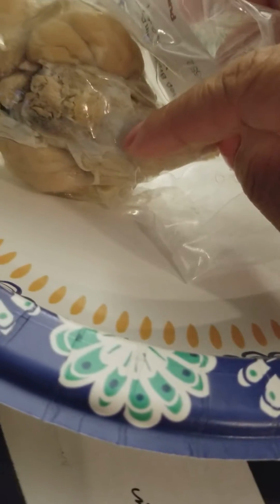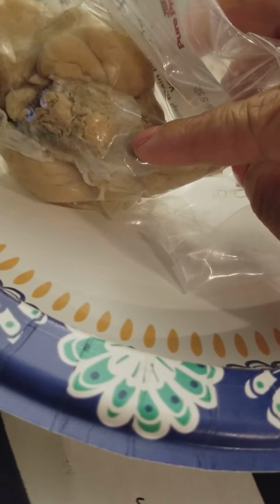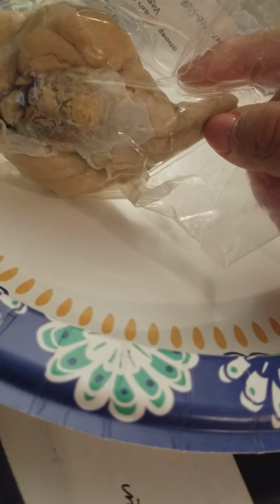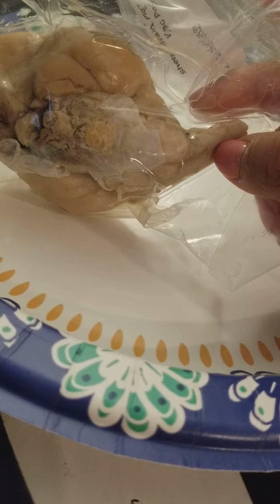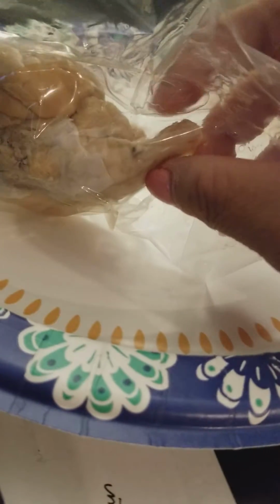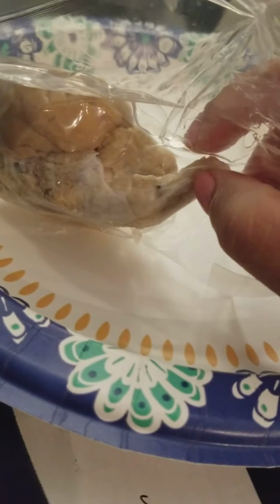This area right here is the cerebellum, which balances equilibrium and is responsible for quick response. This long portion right here is the spinal cord, which sends information to and from the brain. So the spinal cord would be up here, then the medulla oblongata would be along that area, which controls the vital centers.